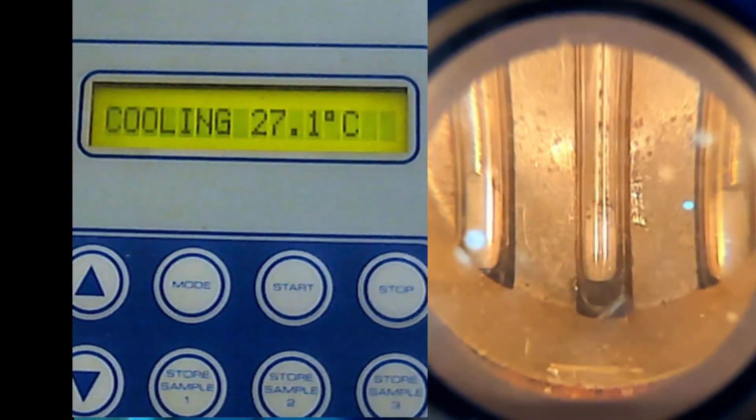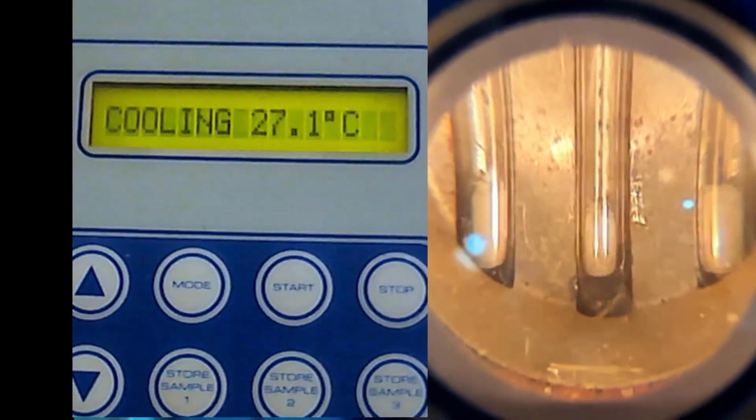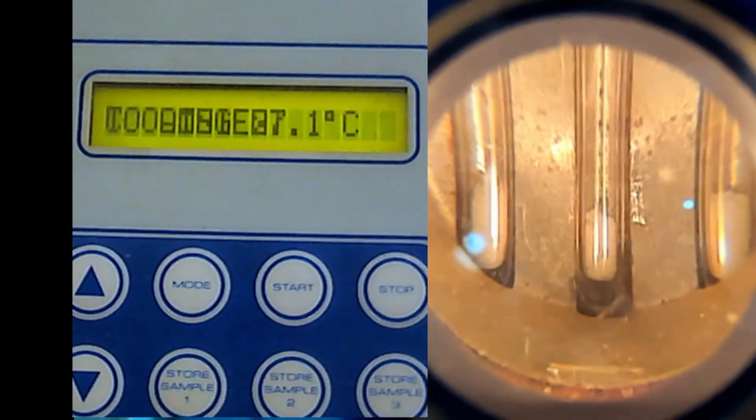In your lab report, at the discussion part, you need to tell what is the precaution during the experimentation. So that's one of the precautions. So you have 3 samples now: this, the middle one, and here.